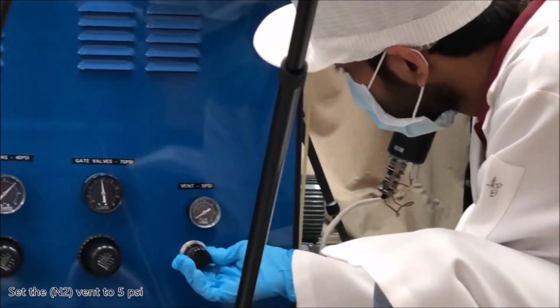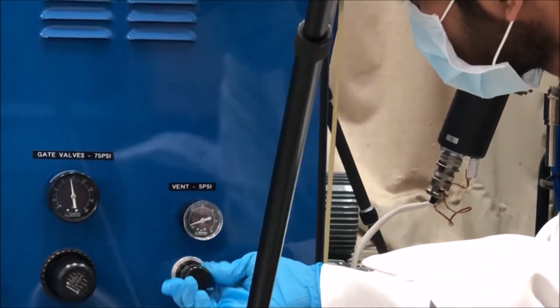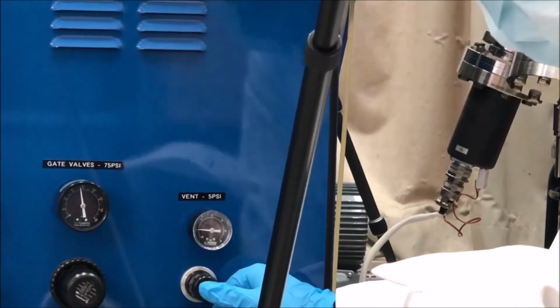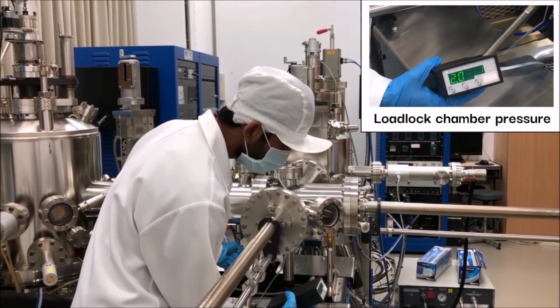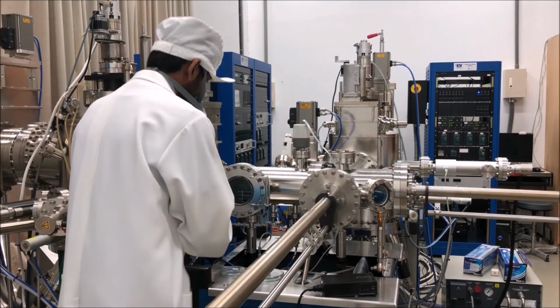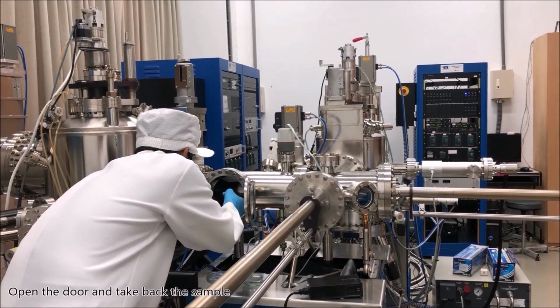Set the vent to 5 psi. Open the nitrogen valve to break the vacuum. Open the door and take back the sample.